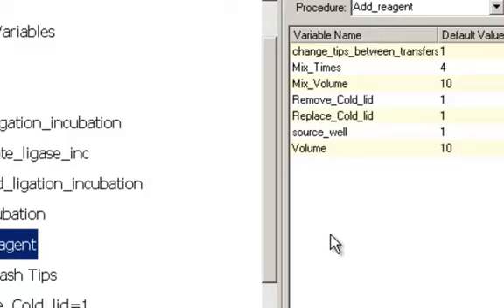So this procedure is called every time we need to transfer reagents from our cold block to our plate. This procedure is used to add the end repair master mix, the ligase master mix, the blunt adapter master mix. It's all the same procedure. We just change the volume we're transferring, change the mixing volume, things like that. But it's all done by this one procedure.